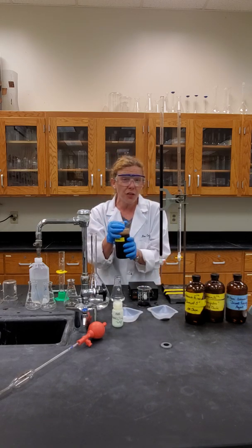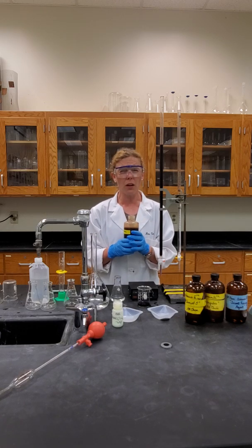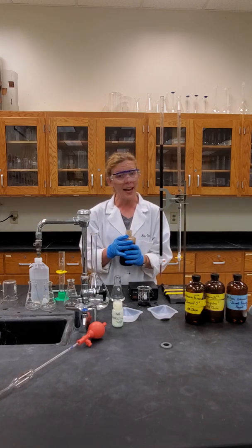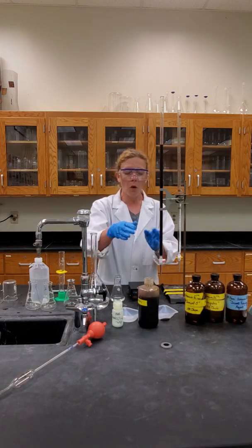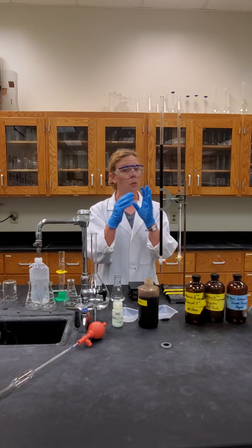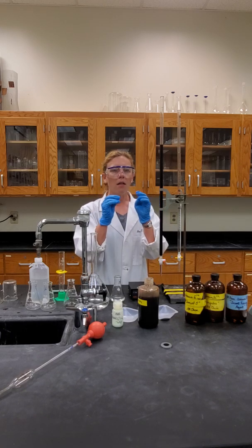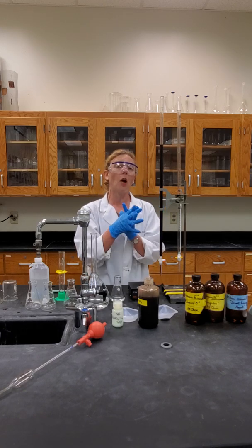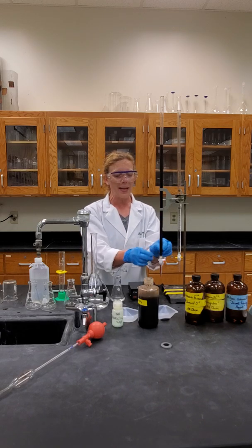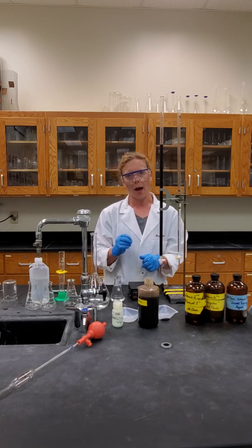In fact, our reagent bottles that hold our potassium permanganate solution look dirty but they're just stained — they're clean but they're stained. So you want to be careful about any paper it comes into contact with. We need to make sure we are being very cognizant of fully rinsing our burette after the potassium permanganate has been introduced, because any plastic portions will become stained if tiny residue is left behind.